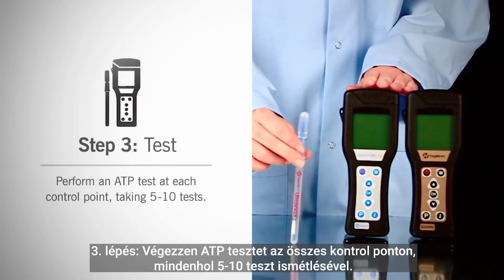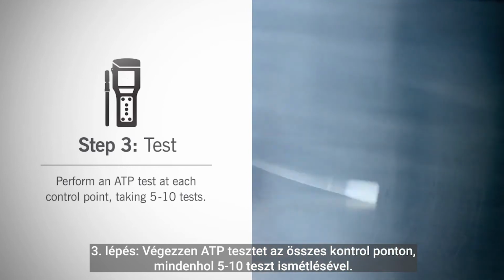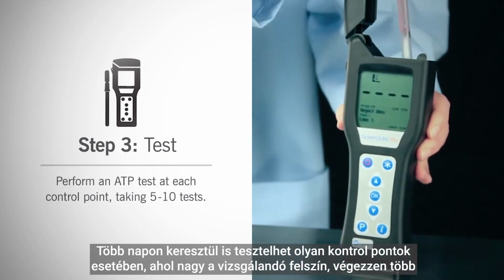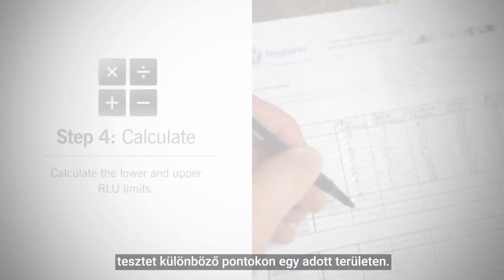Step 3. Perform an ATP test at each control point, taking 5 to 10 replicate tests. You can either perform tests over several days, or, for control points with large surface area, perform multiple tests from different spots at that location.